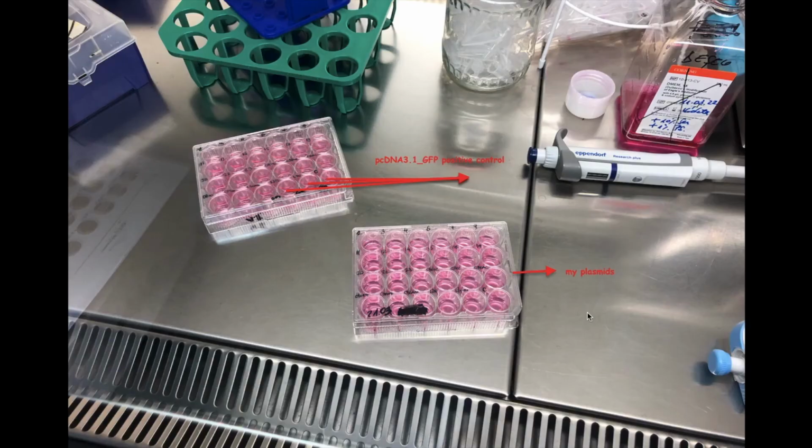Again. So quick update on my progress on my gene therapy project, or better said, lack thereof. So I did a transfection, as I've told you, in 24 wells. These are my plasmids right here, and these are the wells with the control.